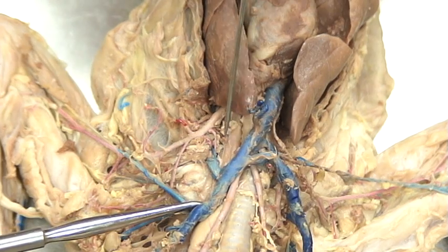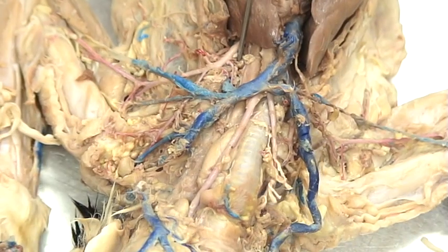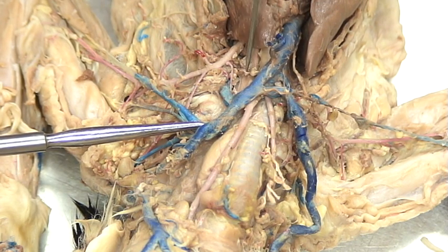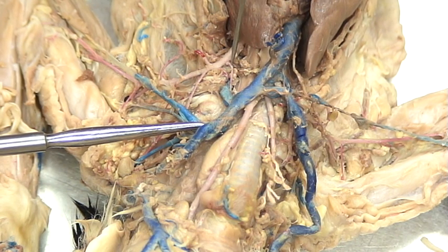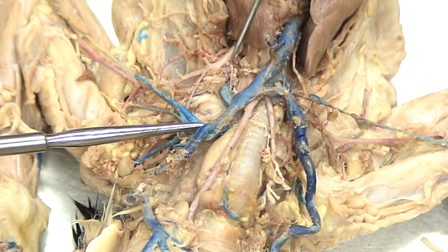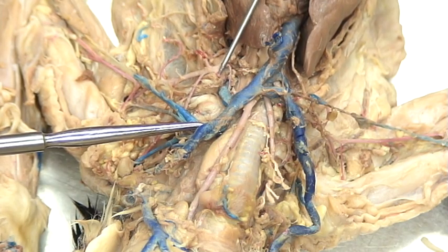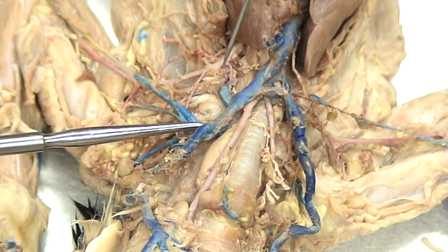Now when we get up to the top parts — the ones that are going to work their way superiorly — we're going to have a division here. These are always tricky to find because they're so small. The first one is right in here and that first one is called the vertebral. The second one sits right on top of that clavicle and that second one is called the costocervical. The third one right here is called the thyrocervical. So it goes in order: vertebral, costocervical, thyrocervical.